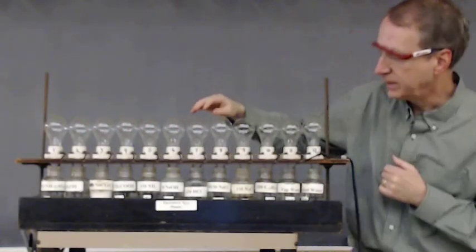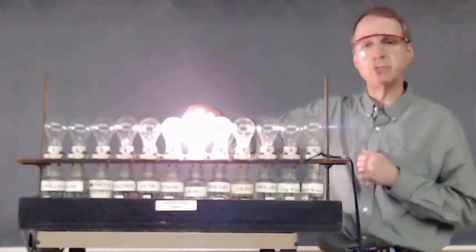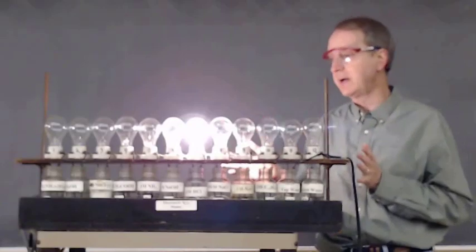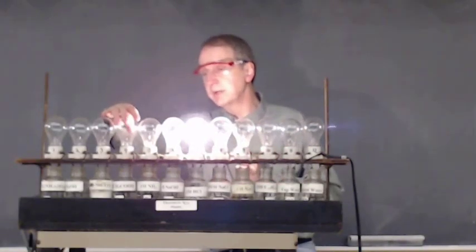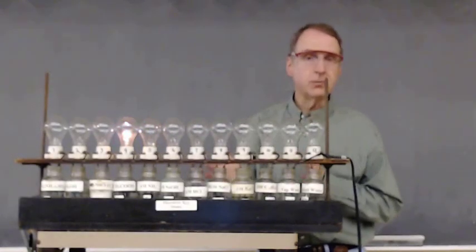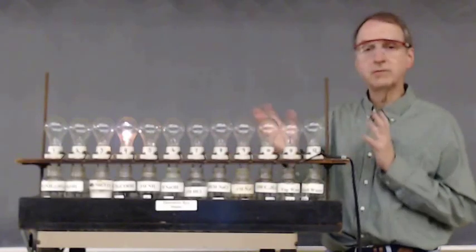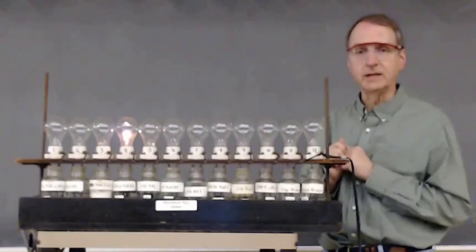Okay, now we also have 0.1 molar HCl. I screw that bulb in, again a bright light, indicating a lot of ions. Down here is 0.1 molar acetic acid. Much dimmer. I'm not sure you can see it. Let me undo the HCl. Some light, but much dimmer, indicating many fewer ions. So again, we have a measure of the number of ions in solution by the brightness of the light.